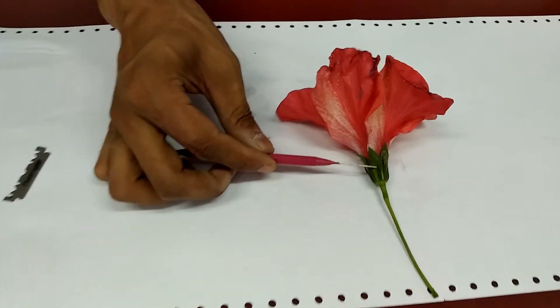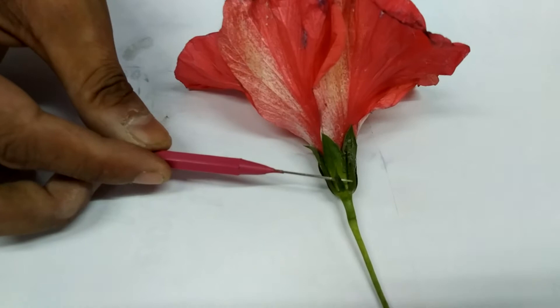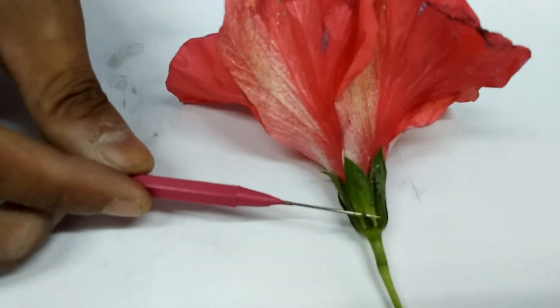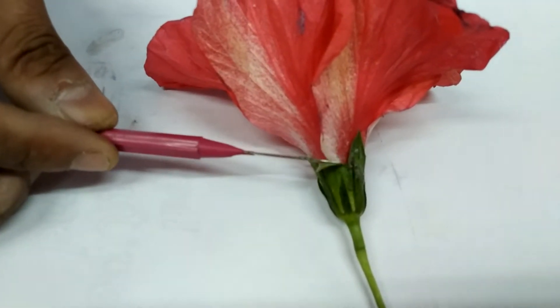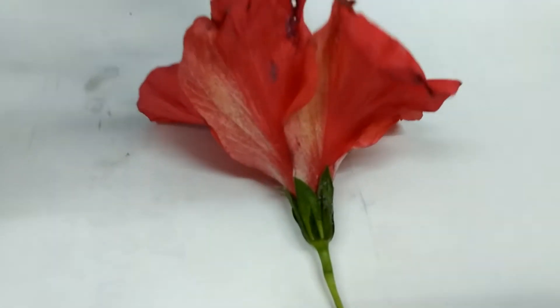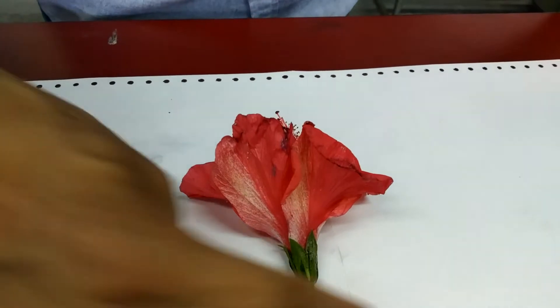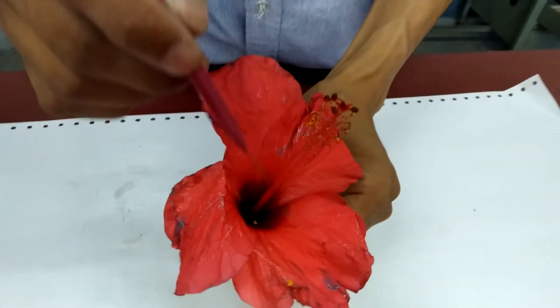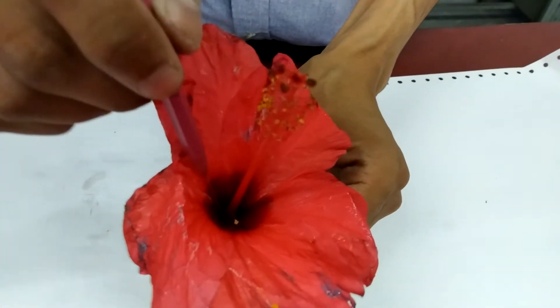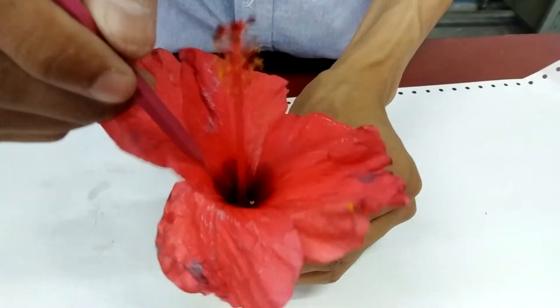The outermost green smaller portion is your epicalyx. The inner portion is your calyx. The red portion is your corolla, and then the inner portion — this entire thing — represents the reproductive parts of the flower.